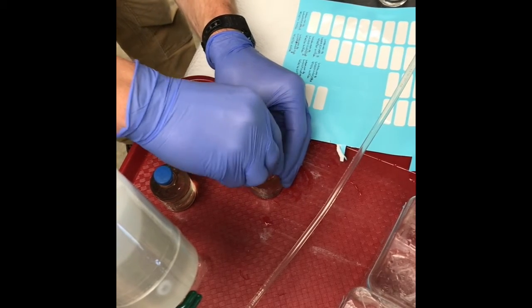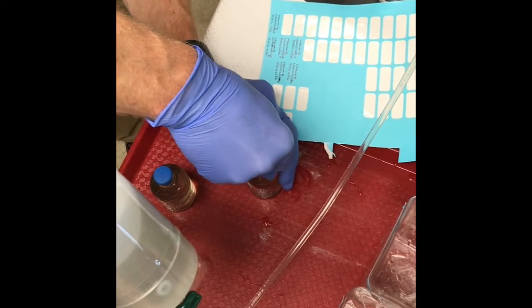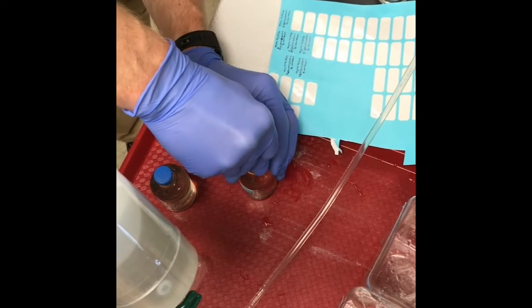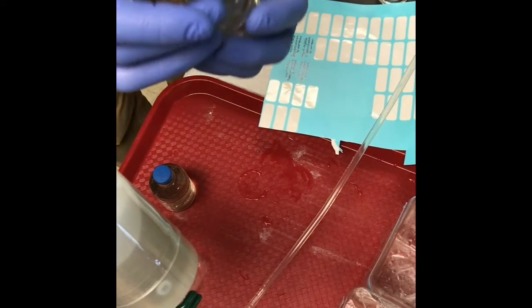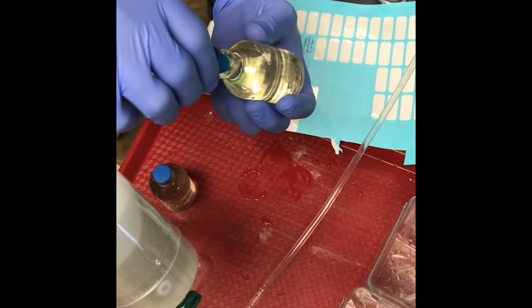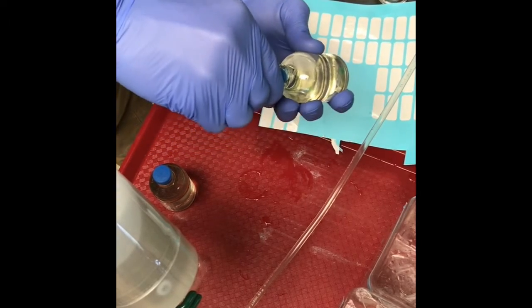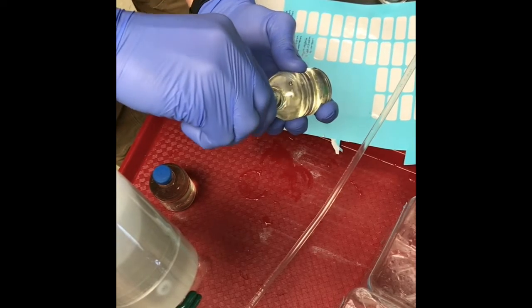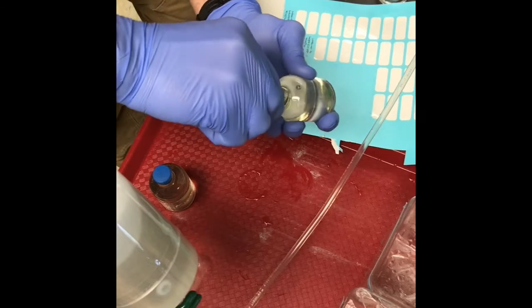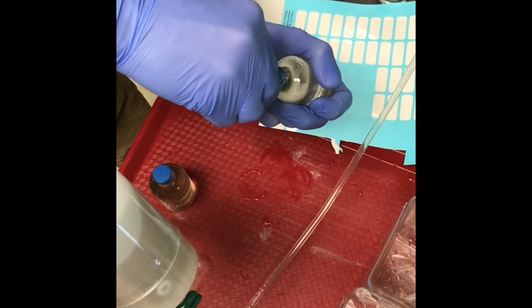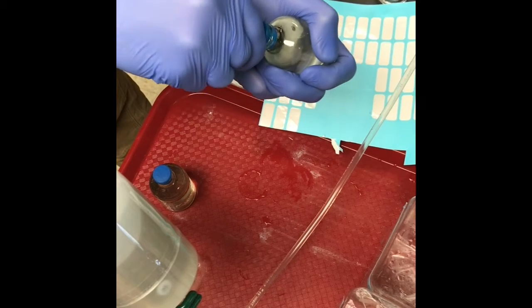I'll put that in. It helps if you twist it a little bit. Once it's starting to go in, the trick is to angle the bottle so the air still in the bottle can escape through the needle as you insert the rubber stopper, basically purging all the gas present in the sample out through that needle.